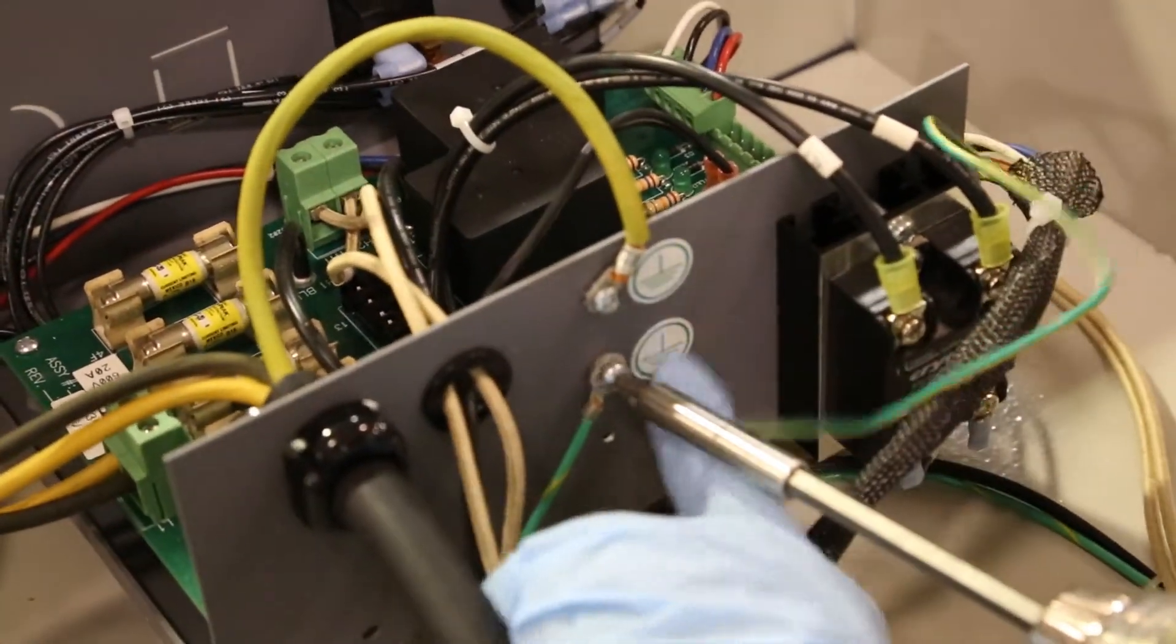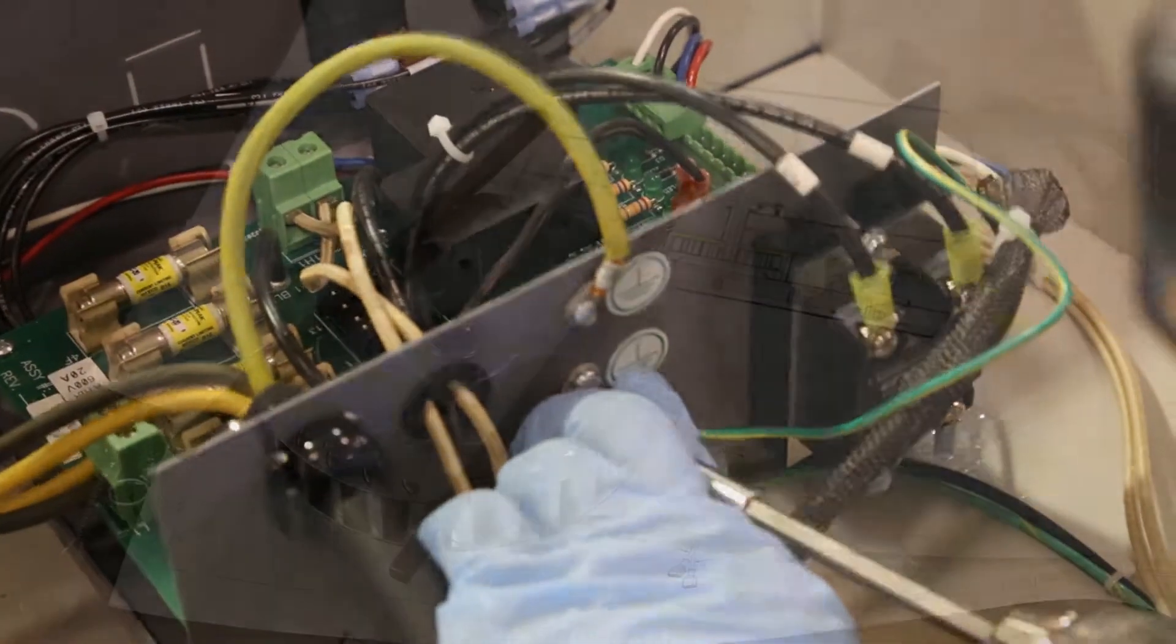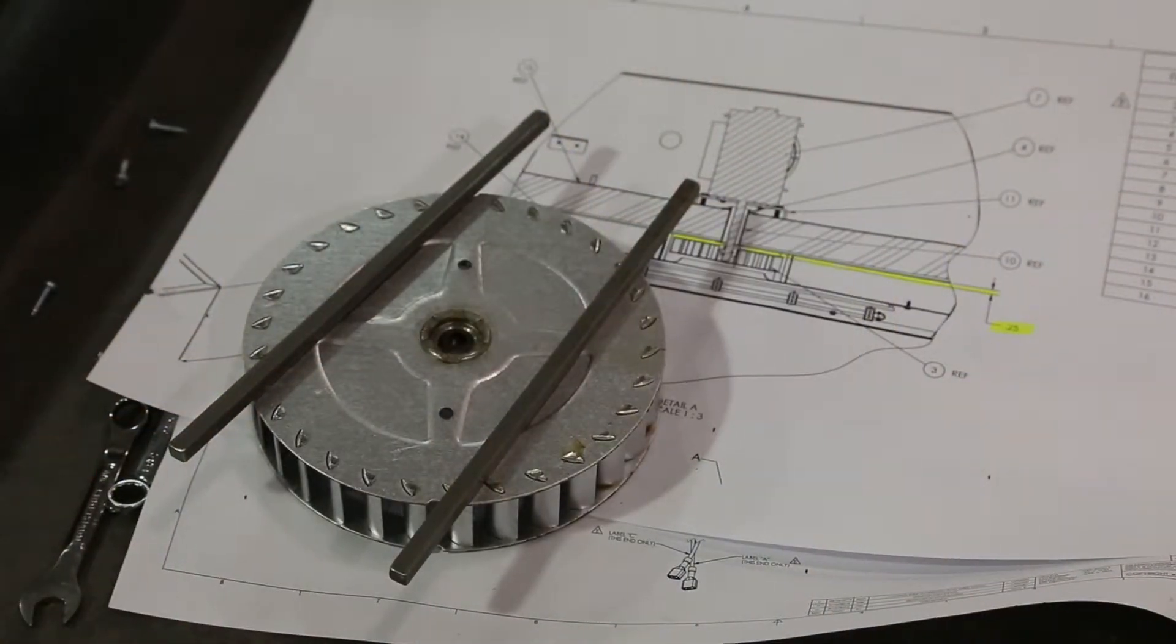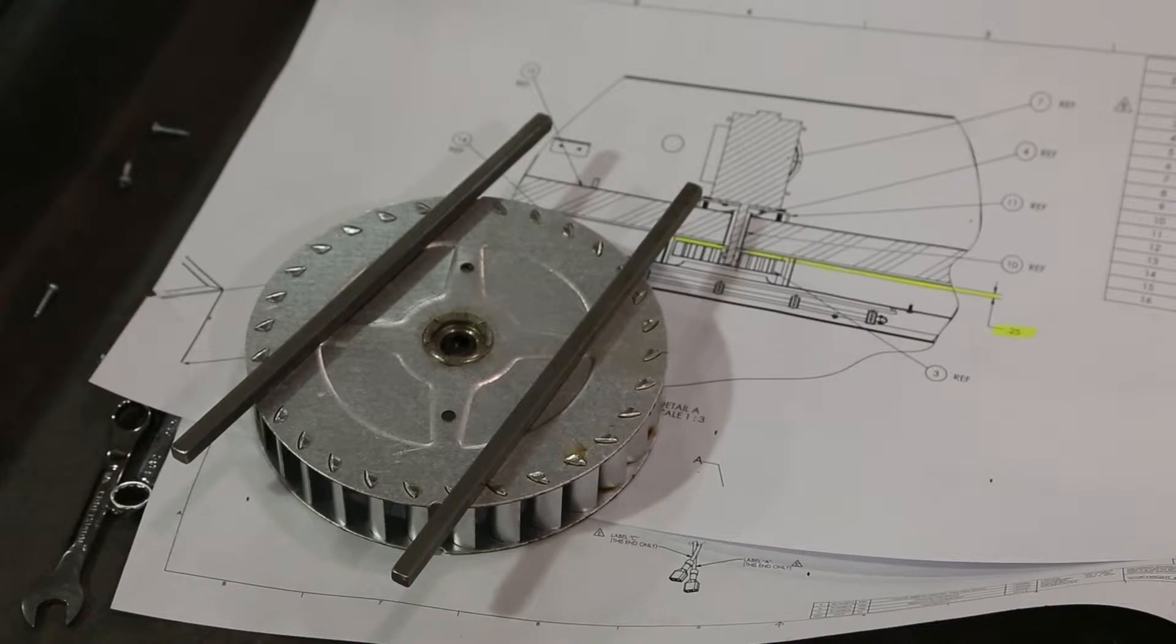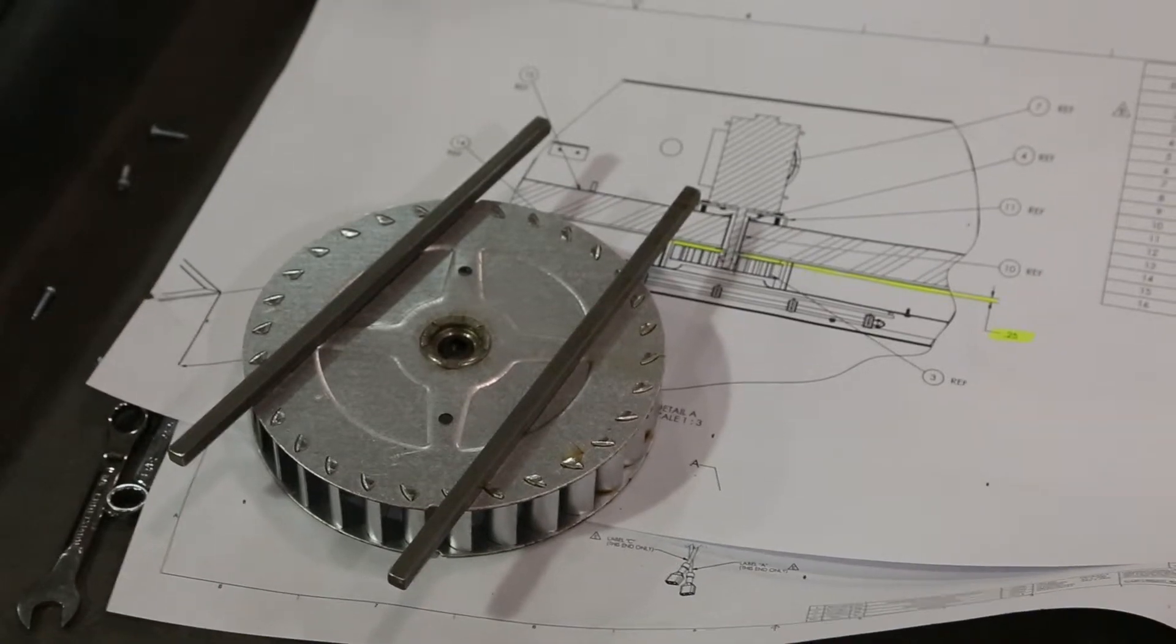Reconnect the ground wires. When replacing the fan wheel, use quarter inch key stock to ensure the proper gap between the oven and the fan wheel.